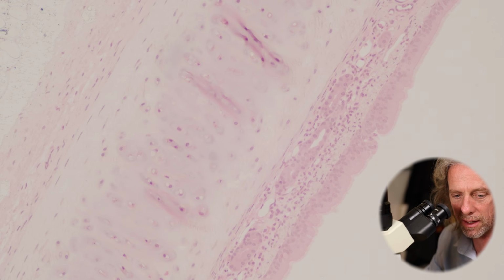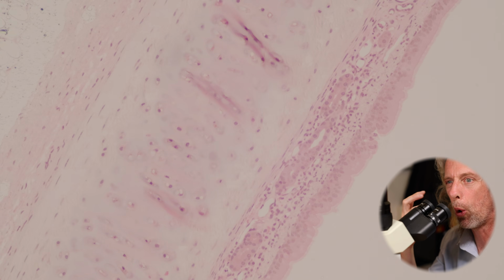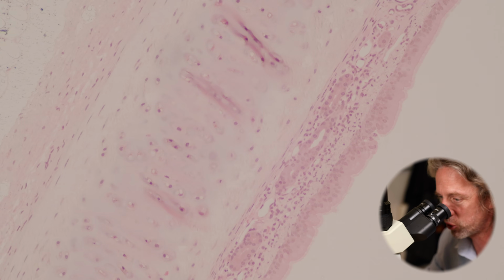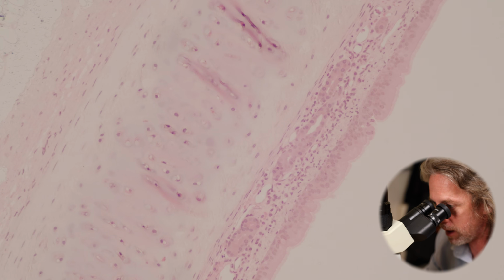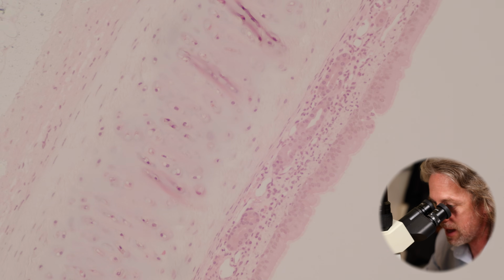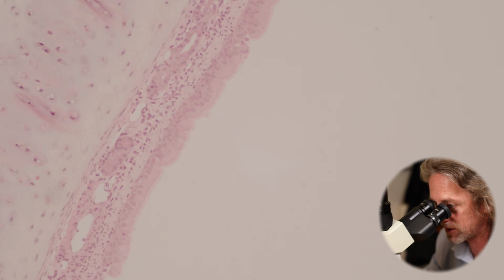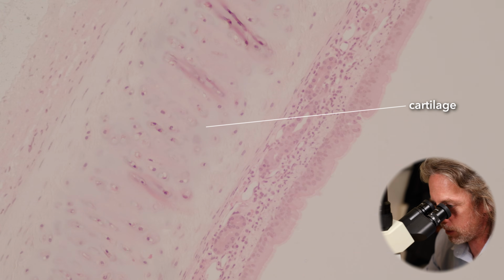So breathing is very drying, isn't it? You know what it's like if you've had a blocked nose and you've been asleep and you wake up with a sore, dry mouth. That's the air drying out your mouth. That's drying out the cells. This is bad for the cells. This will kill the cells. So the airway is kept moist. It's kept covered in fluid so the cells don't dry out, so they're protected. And that's a big part of what these glands are doing. That's the submucosa. So mucosa, submucosa, and then up against that, we've now got the cartilage ring.